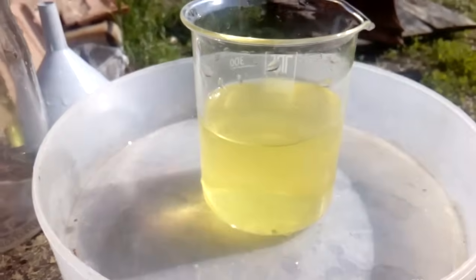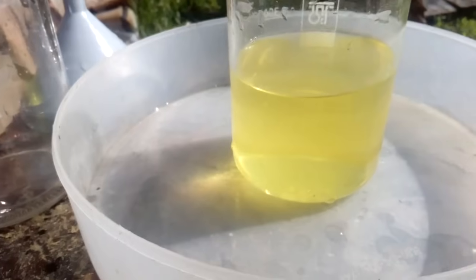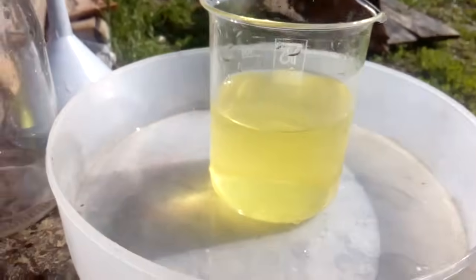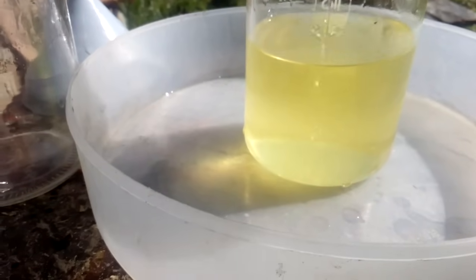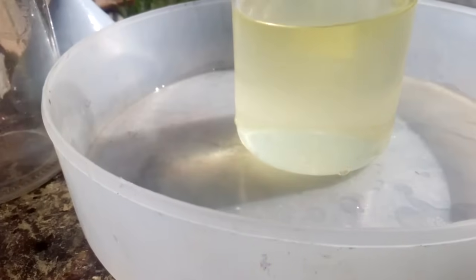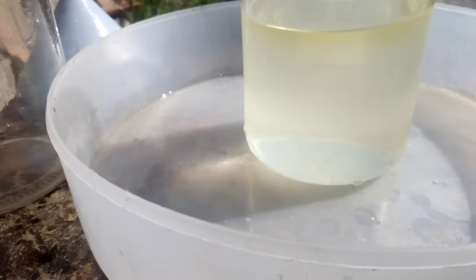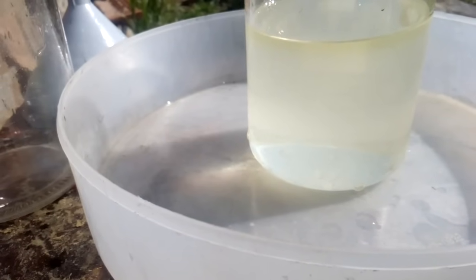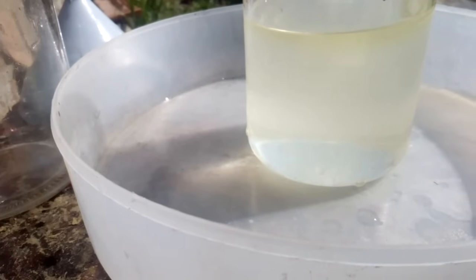Okay guys, it's time. We drop our cutlery gold. This is our solution - nice color. I have some SMB dissolved in water and let's go. Not a quick reaction, so I do not expect too much gold here.